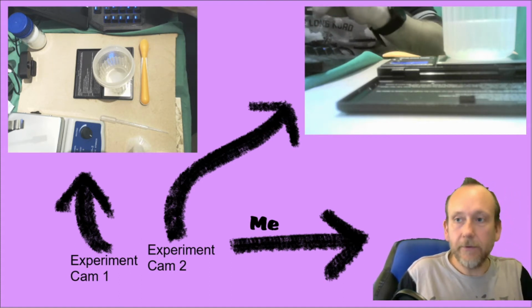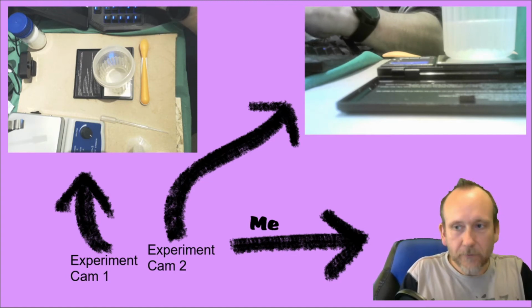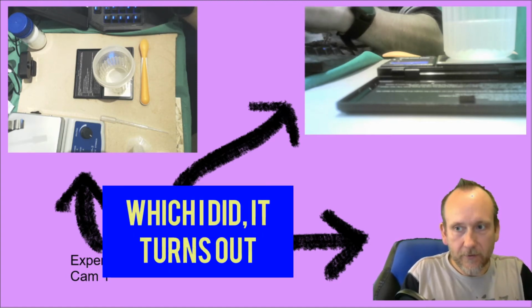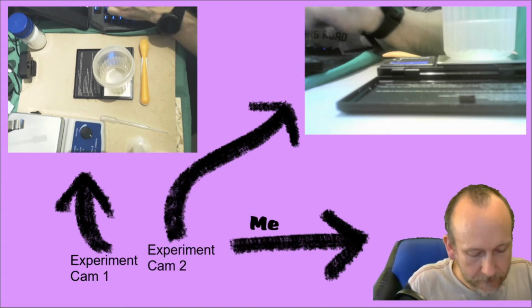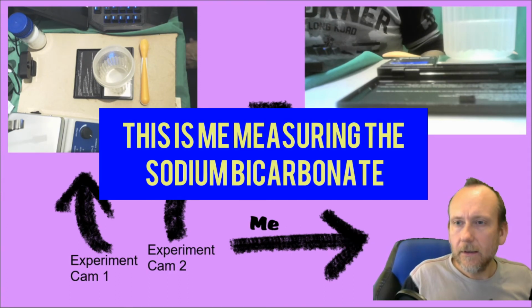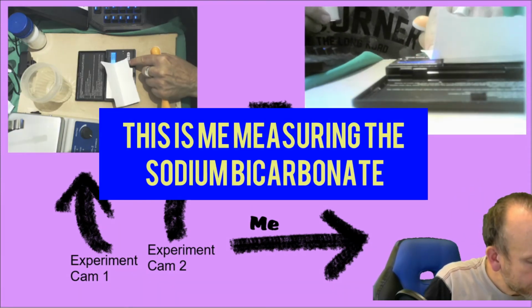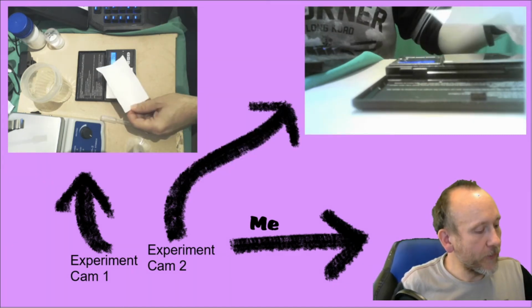So after stirring, now the reason why I'm writing this down is because if I lost some water, then that's going to be important for later on. Okay, so it's 2.46 grams.